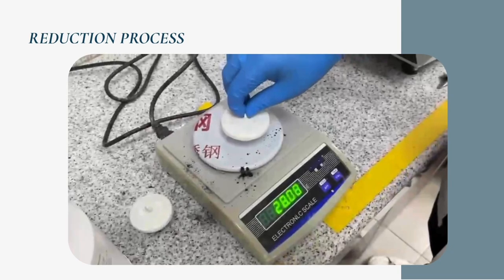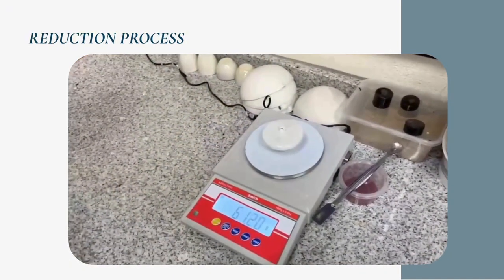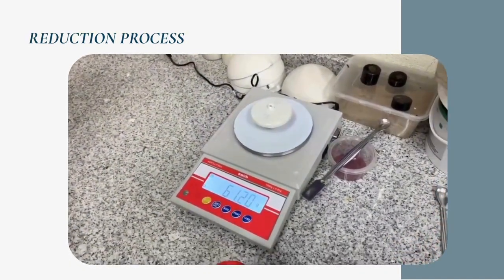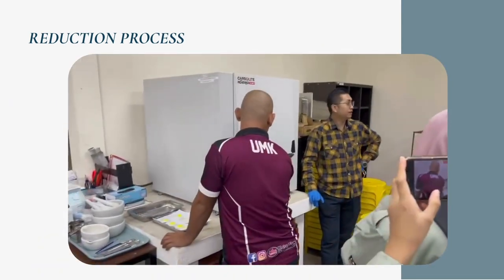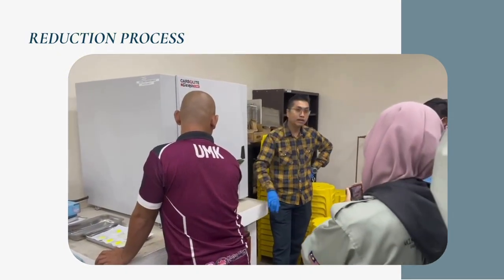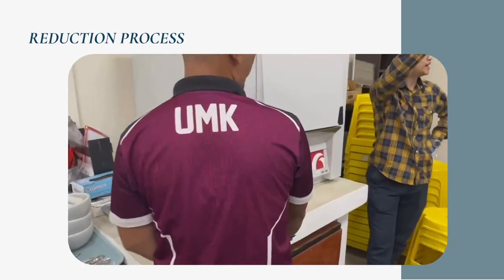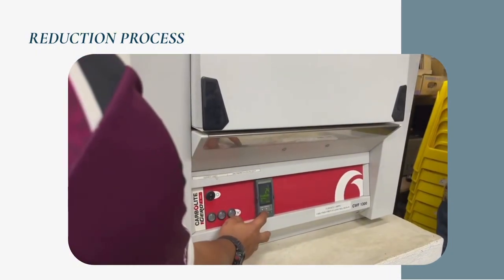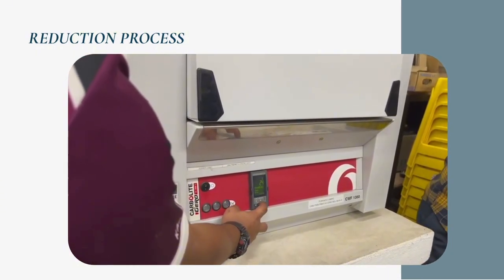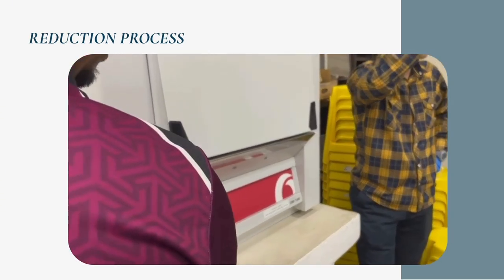Next, both crucibles were placed inside a muffle furnace. The samples were heated at a temperature between 900 and 1000 degrees Celsius for about 45 minutes. During this heating process, carbon acts as a reducing agent and removes oxygen from the metal oxide. As a result, iron oxide was reduced to metallic iron and copper(II) oxide was reduced to metallic copper. After heating, the crucibles were removed carefully using tongs and allowed to cool down to room temperature before further processing.